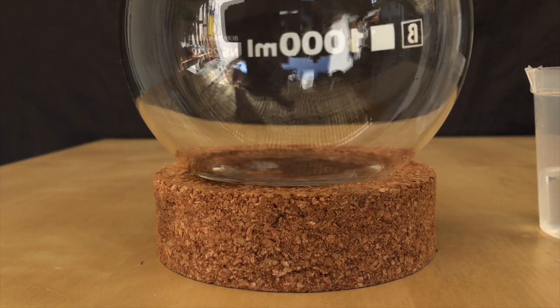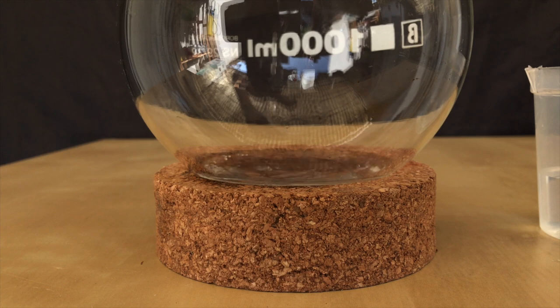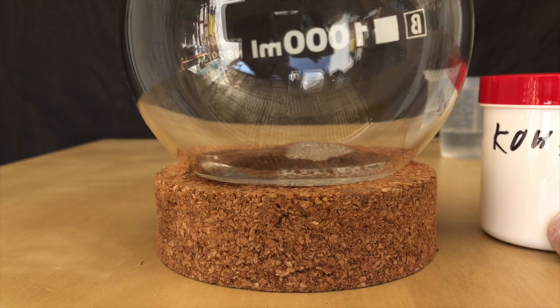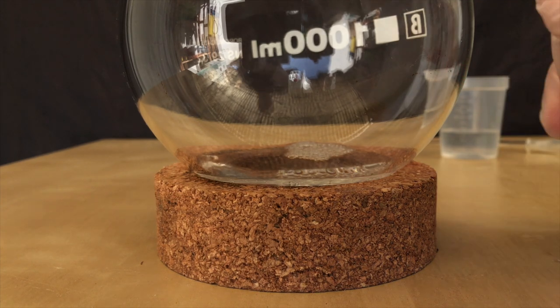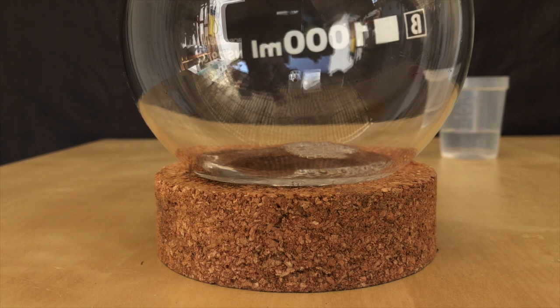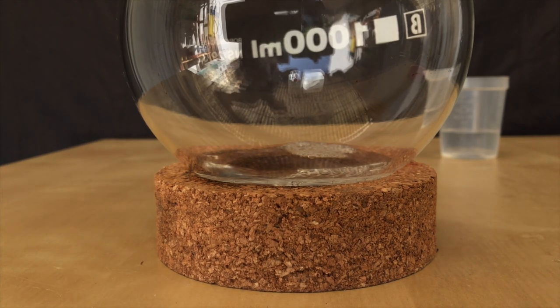Normally, when the ammonia is being added, brown silver oxide should precipitate out. Afterwards, more ammonia should be added until it completely dissolves again. I guess I added enough ammonia in the first place and it decided to stay in solution and nothing even precipitated out.